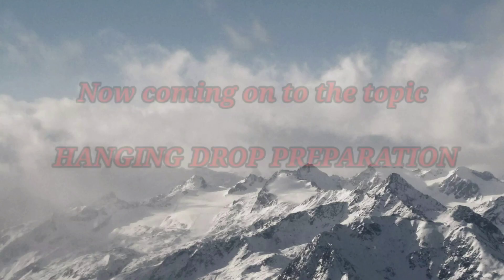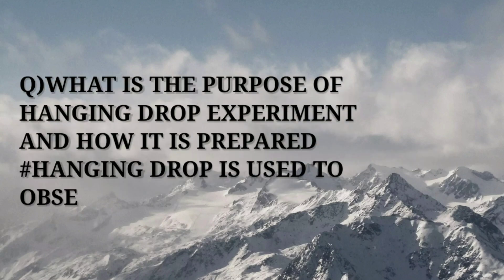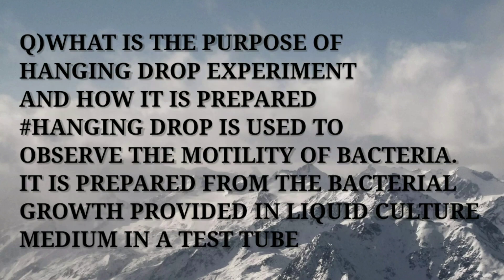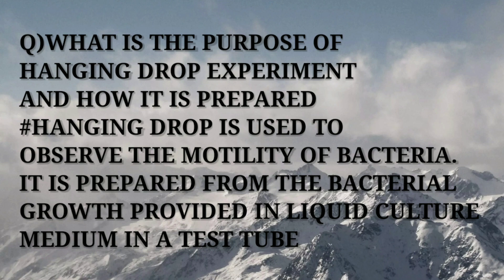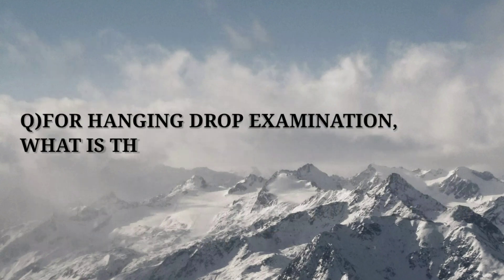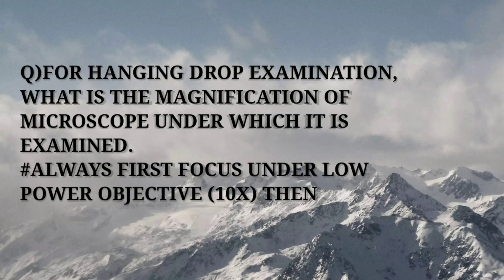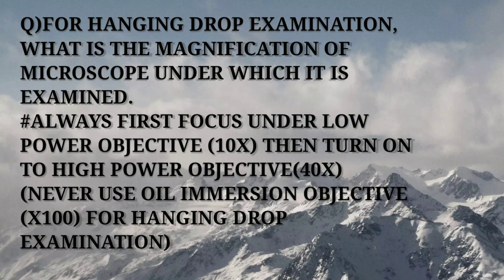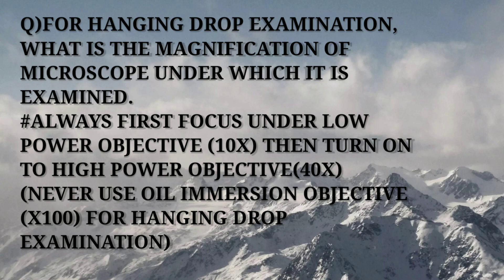Now coming on to hanging drop preparation. Question: What is the purpose of hanging drop experiment and how is it prepared? Answer: Hanging drop is used to observe the motility of bacteria. It is prepared from bacterial growth in a liquid culture medium in a test tube. For hanging drop examination, first focus under low power objective (10x), then turn to high power objective (40x). Never use oil immersion objective (100x) for hanging drop examination.